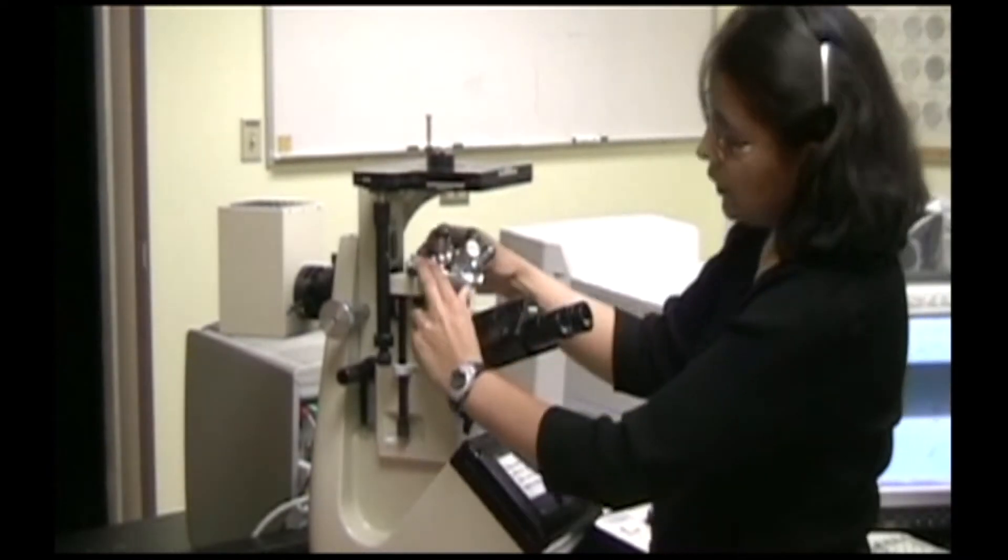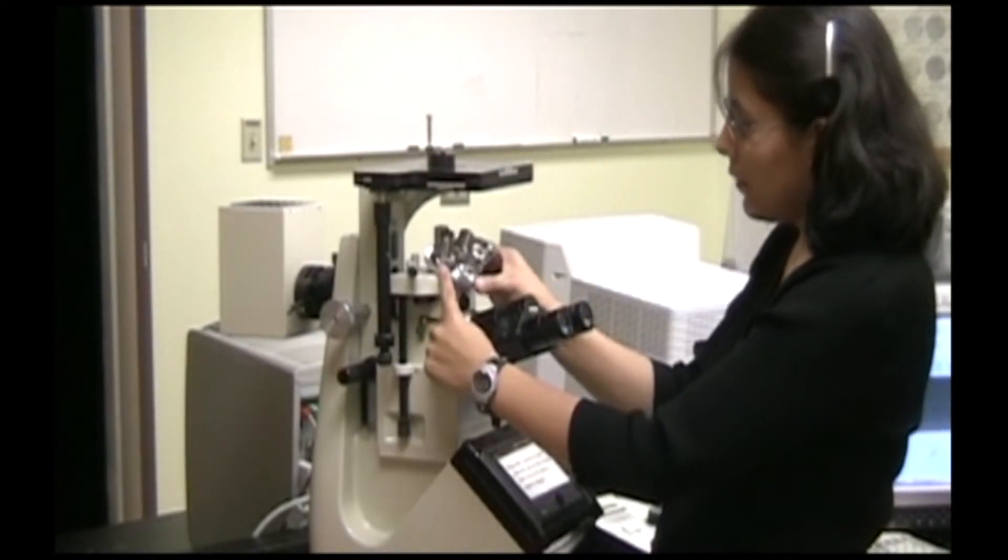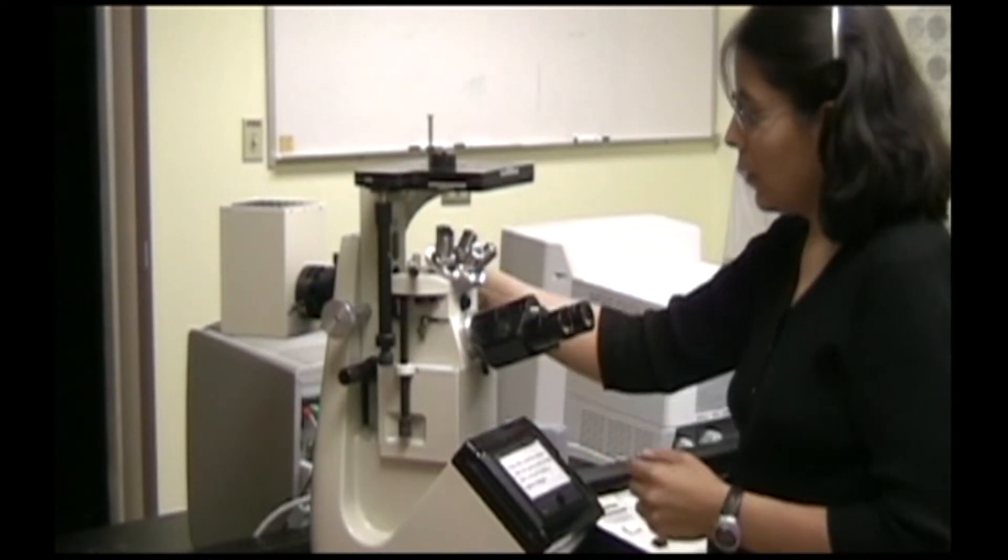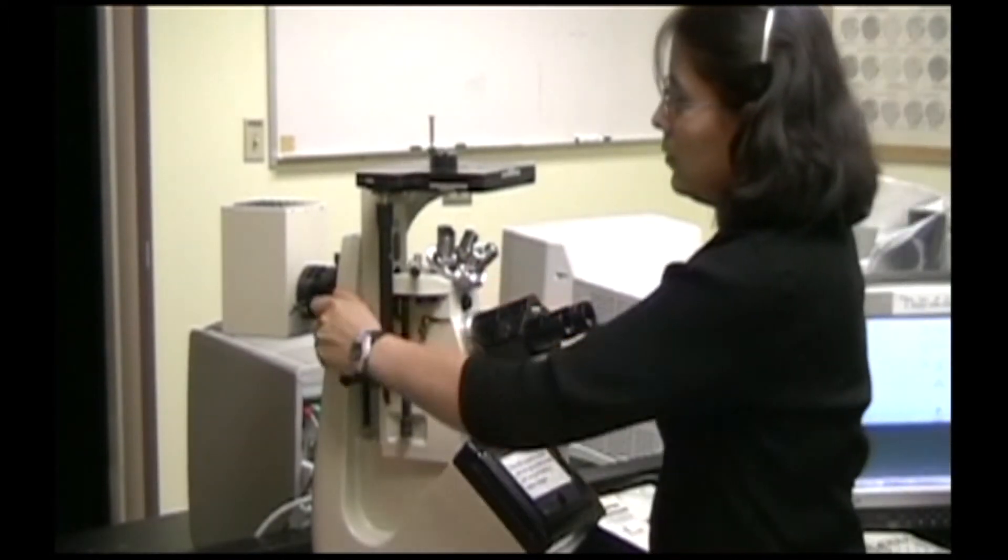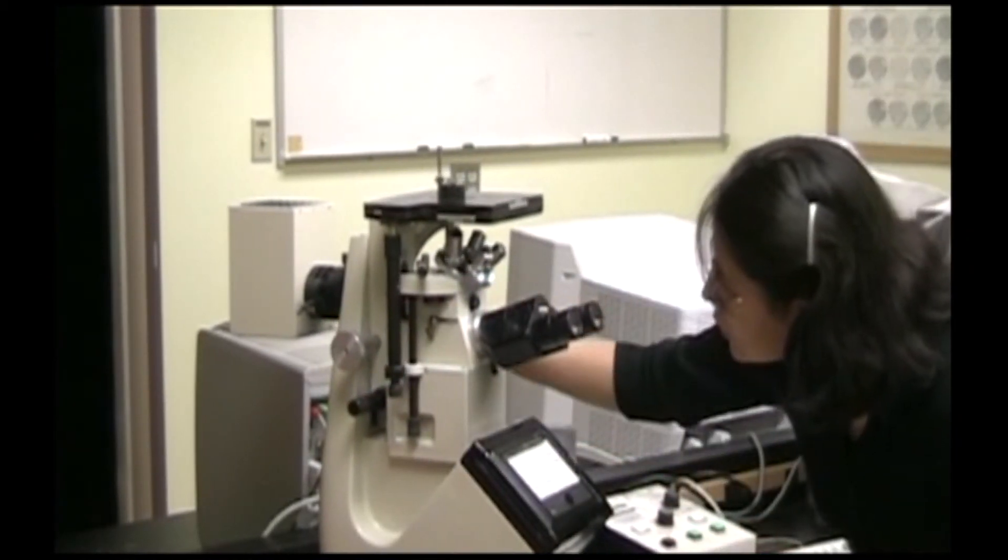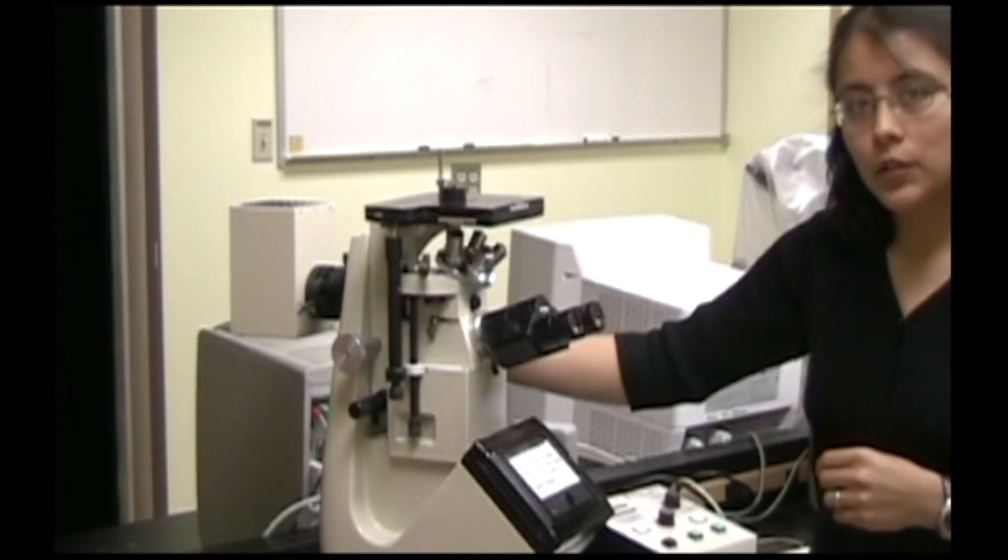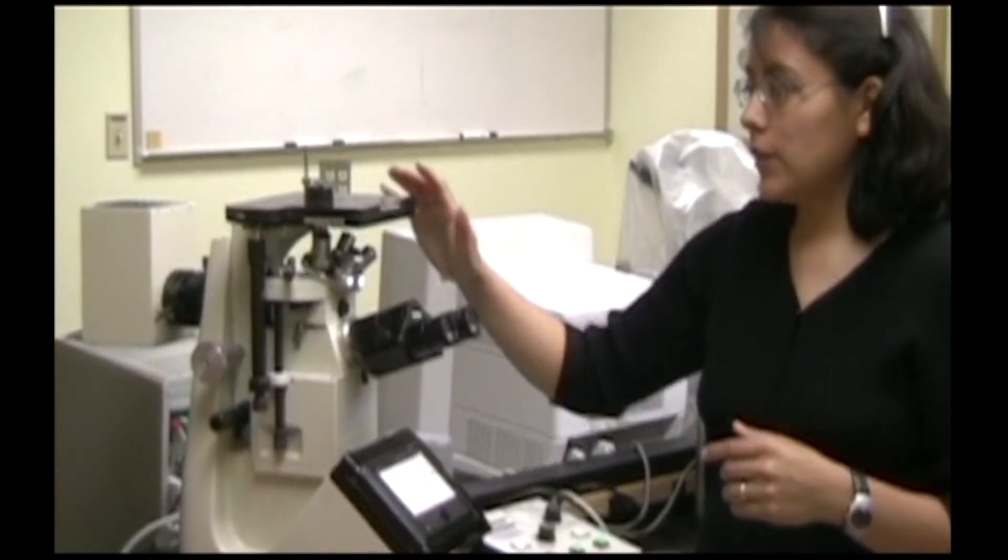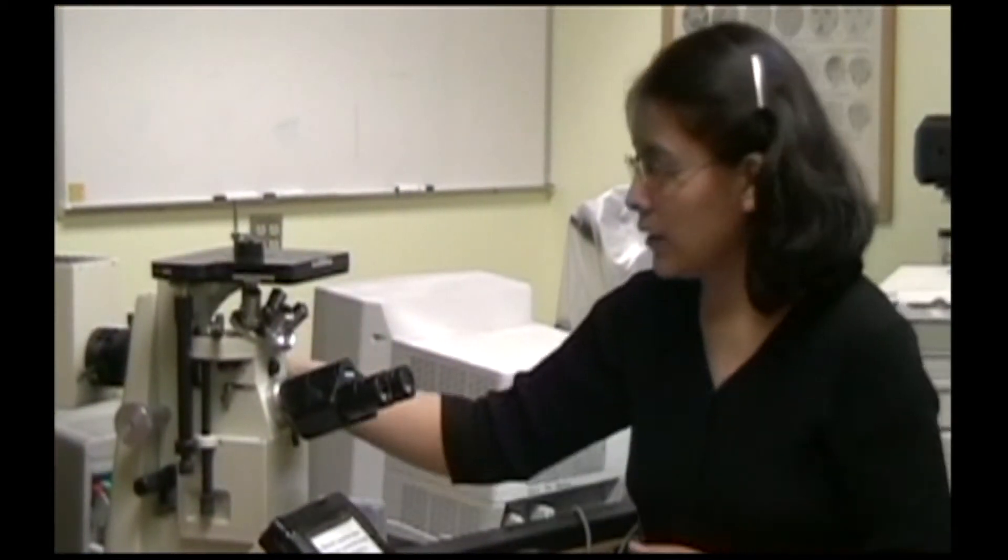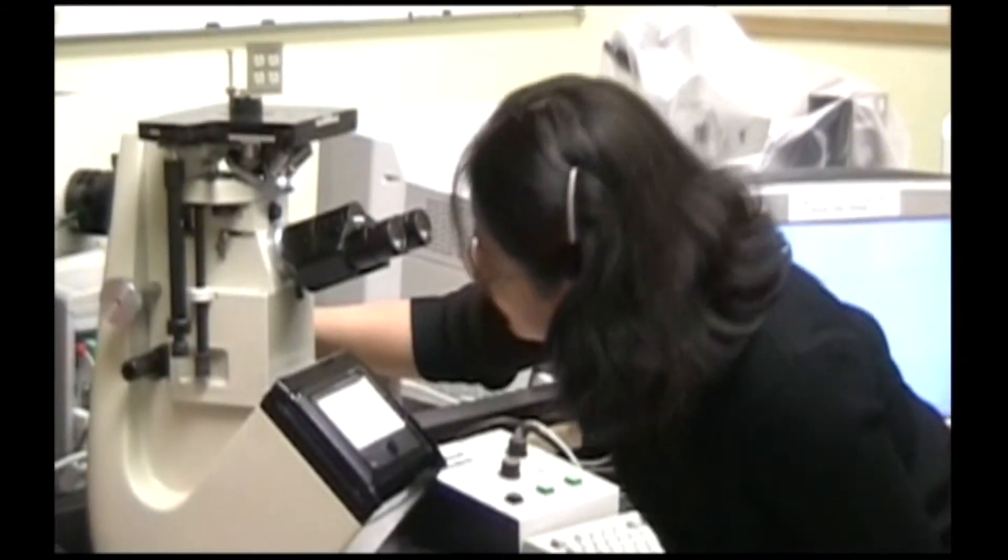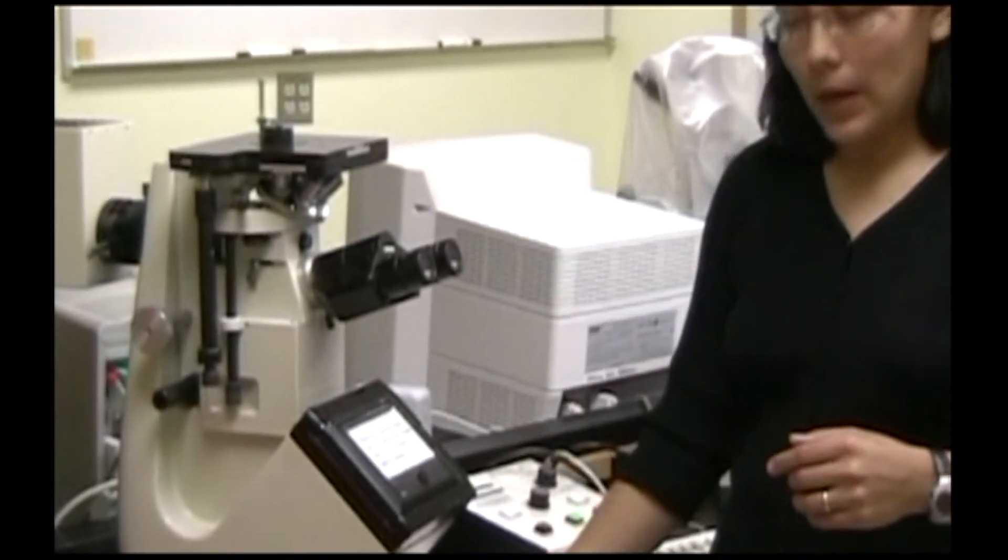You should change the objective lens to the 5x and lower the stage so that your sample surface is as close as possible to the 5x objective lens without ramming the stage or the sample into the objective lens. Turn the power on.